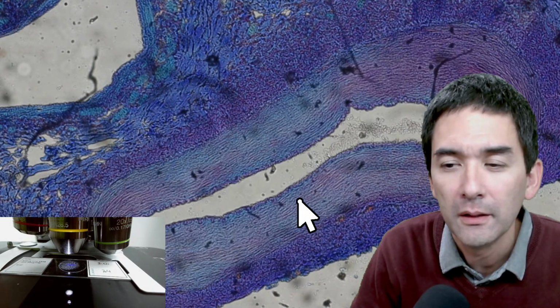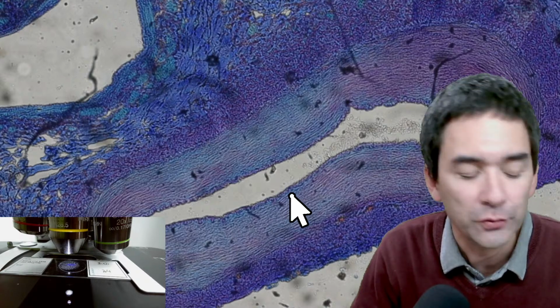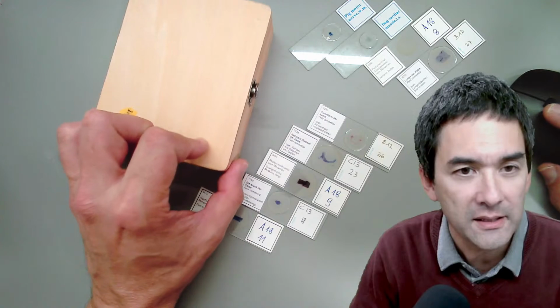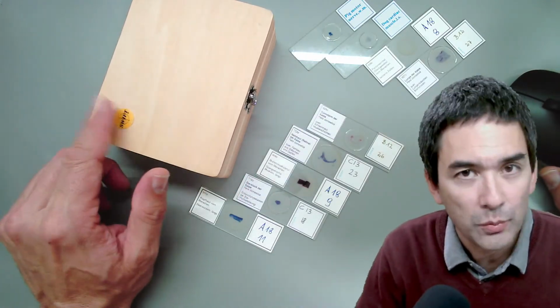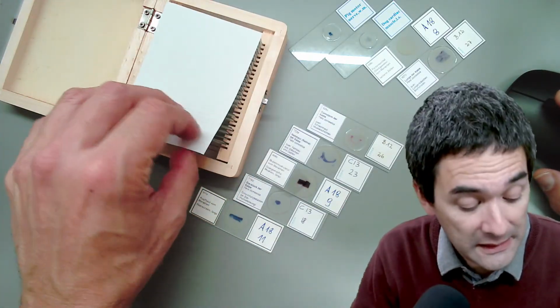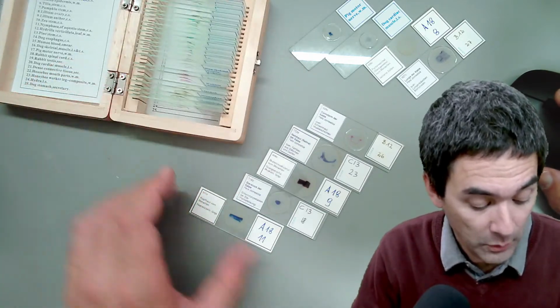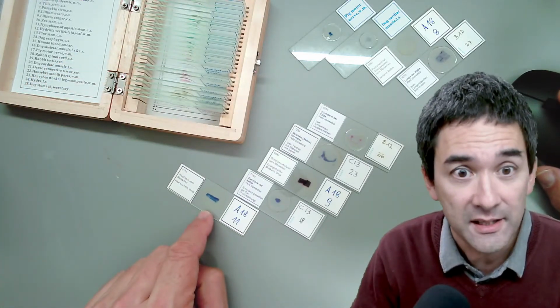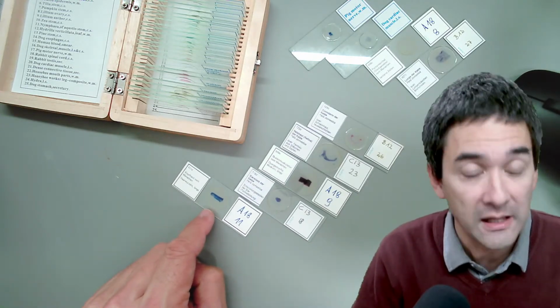Okay, yeah. So there's a question again: where do you buy all of these slides from? Well, the easiest way to buy slides is, I bought this from Amazon. Okay, so this is one thing, and there is indeed a company in Germany, a well-known one, who sells these slides here, and I'm going to put a link to a catalog. You can even buy them individually. Yeah, and they have hundreds of slides.